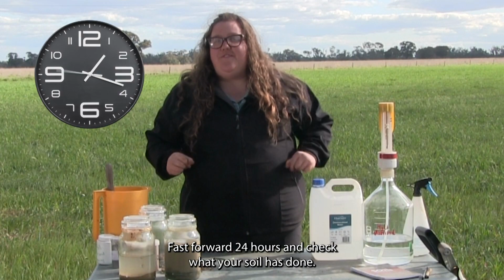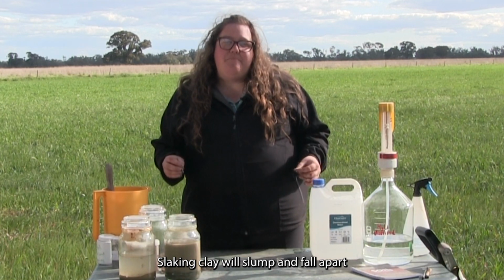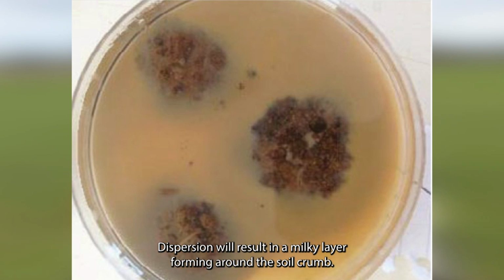Fast forward 24 hours and check what your soil has done. Slaking clay will slump and fall apart in the water, forming a small blob of mud. However, the water will remain clear. Dispersion will result in a milky layer forming around the soil crumb.